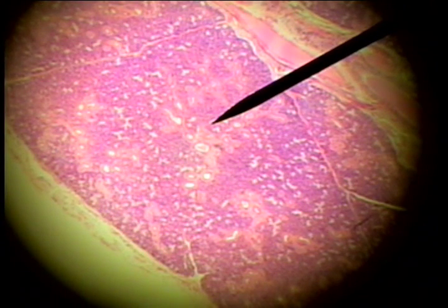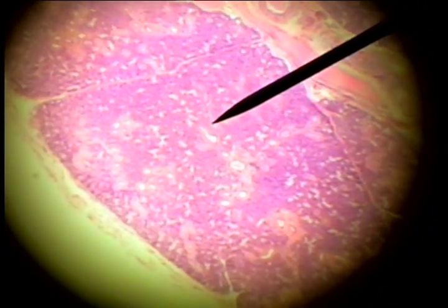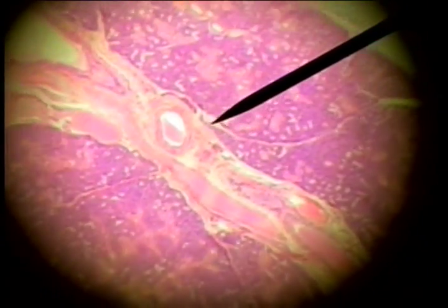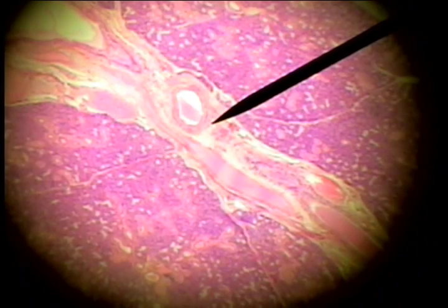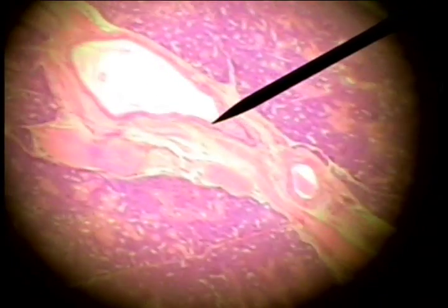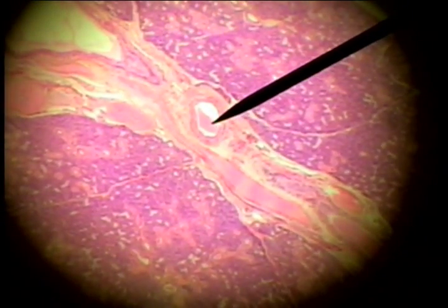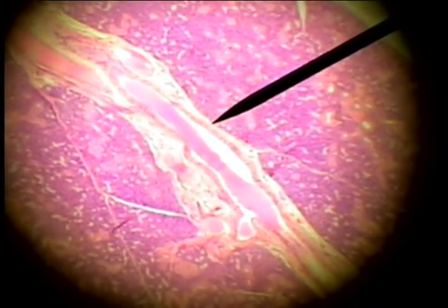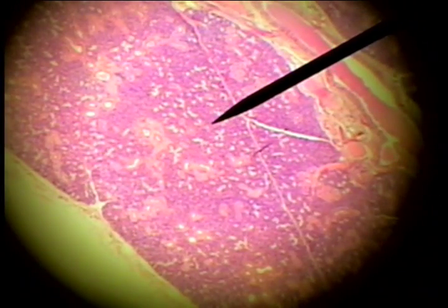This tissue associated with the digestive system is our salivary gland tissue. Here's a portion of the gland here, and here's another portion of the gland. We see connective tissue, a blood vessel, a vein, and an artery — all part of the connective tissue associated with this salivary gland organ.